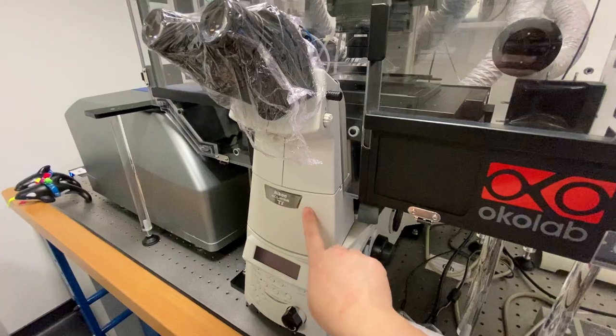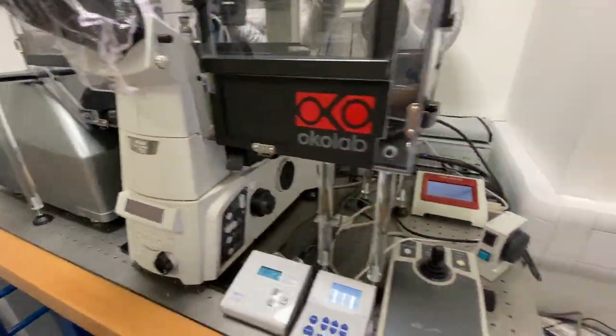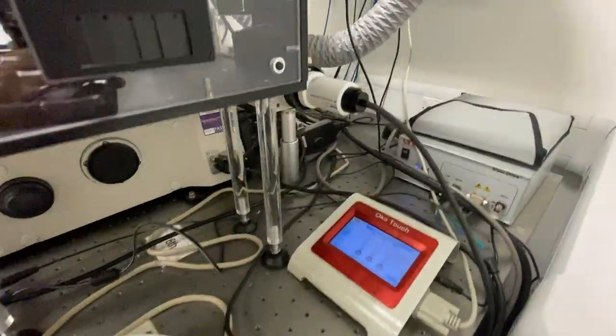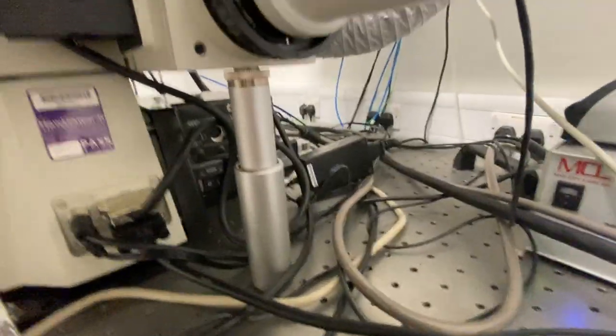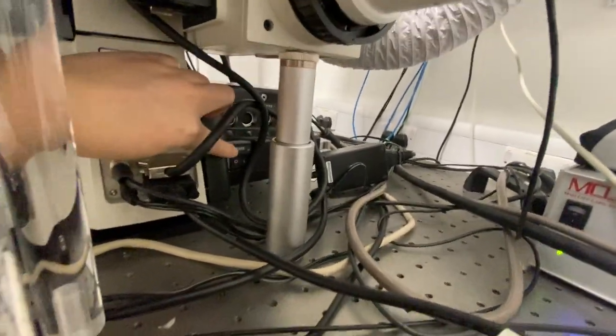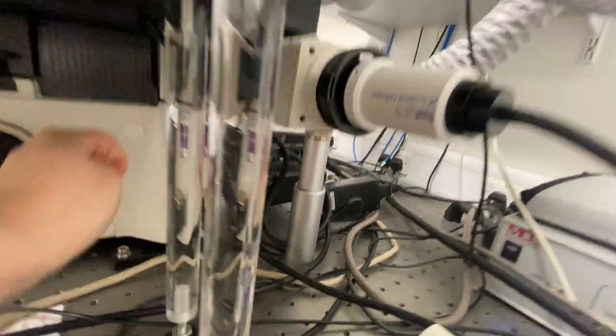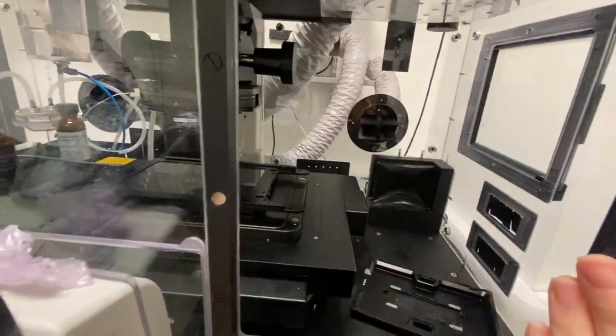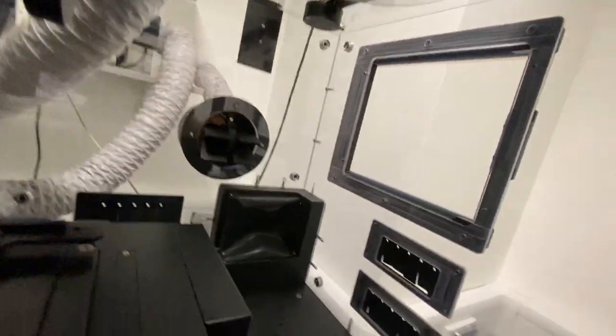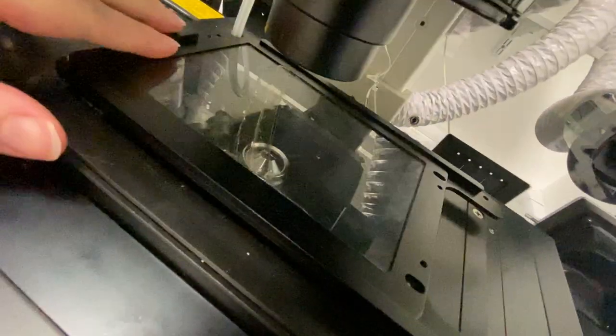The switch for the main body of the microscope is back here. This switch here. But before you switch the main body on, you always have to check that the last person hasn't left their sample inside.